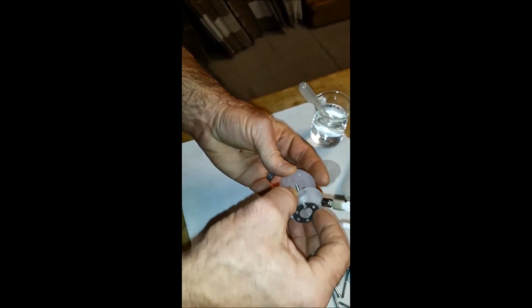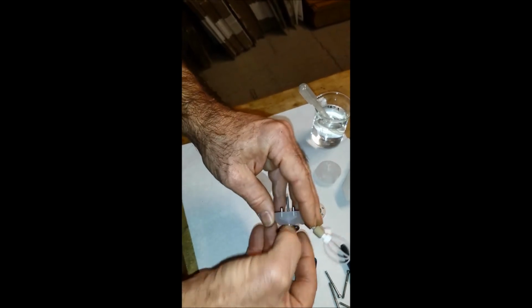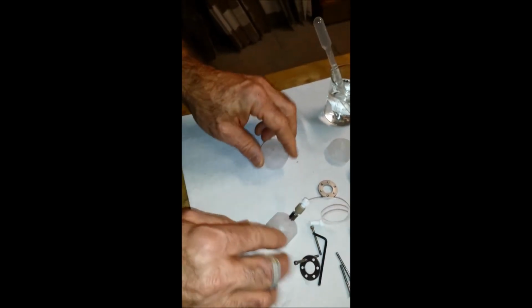Then you want to take the flowcell apart and carefully wipe and dry everything off.